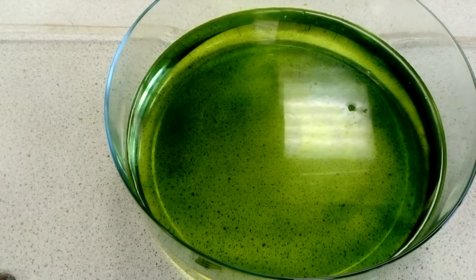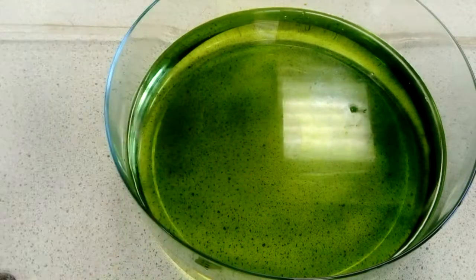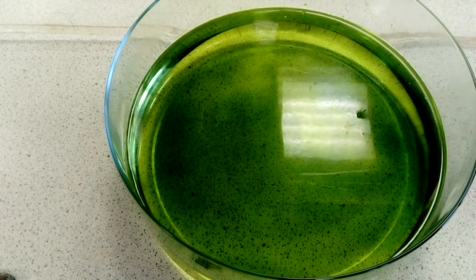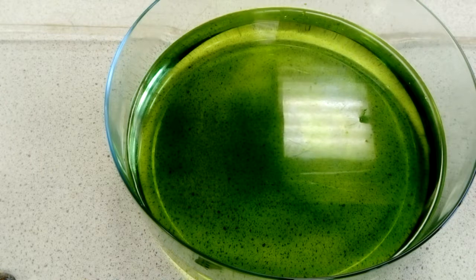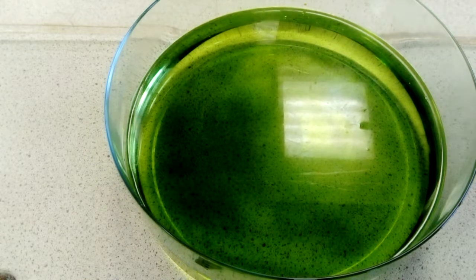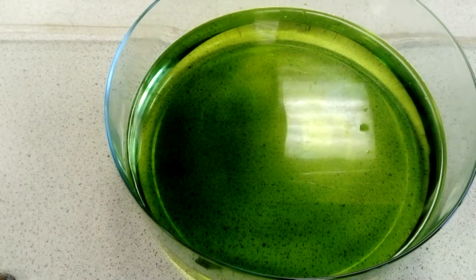All 3 of these are stored underneath oil, and we store them underneath oil because they will react with the air. The first one that we're going to look at is the one at the top of the group, so lithium. Lithium should be the least reactive.